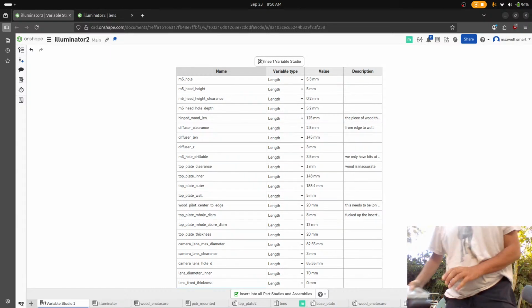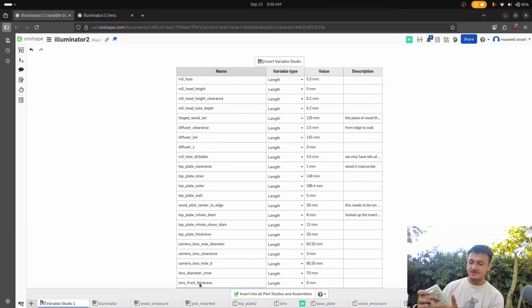Okay, I also forgot there's one more little bit, which is that we actually have the Tiffen filter. So we should just put this on, I think. So how do we do this? Oh, it comes out like this. We should actually take some pictures with this thing. I don't think I ever took a picture with it. So I bought this for the excitation of GFP. Oh, we need a battery. Okay. But that's going to be the lens stack up, so that's what we have to measure by.